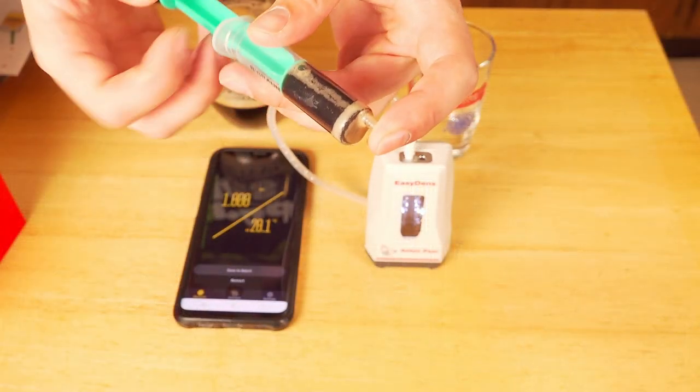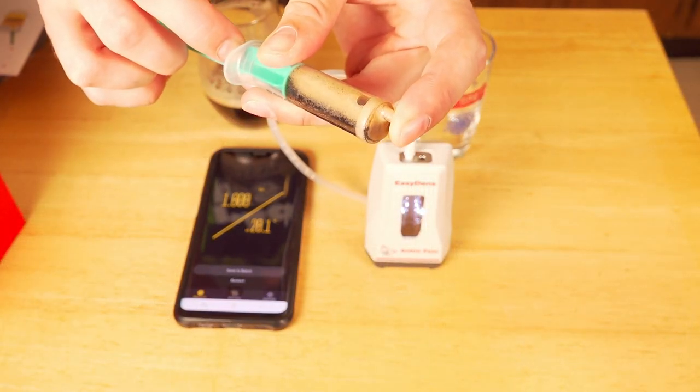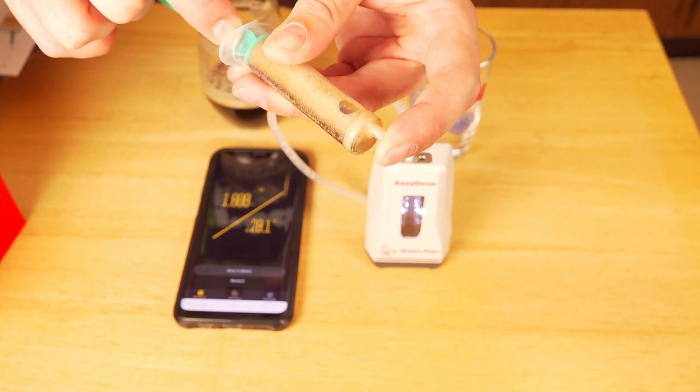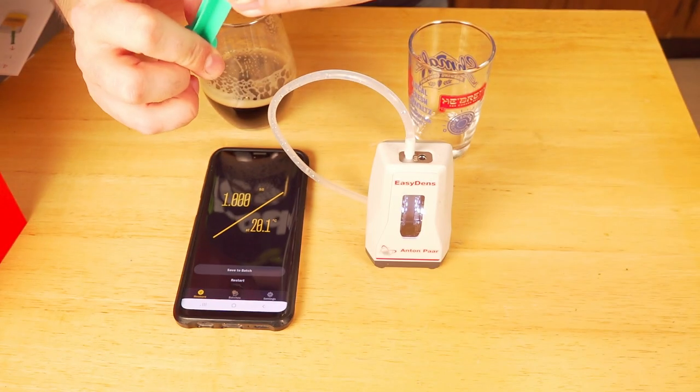When you're measuring your specific gravity you're going to need to take a sample of wort or beer and treat it accordingly to take an accurate measurement. The first thing you're going to want to do is decarbonate it. You want to pull the CO2 that's in solution — even during fermentation there's going to be dissolved CO2 — out of solution so you have a much more accurate reading. Usually that just means shaking it up a lot, or pouring back and forth between two containers using a hard pour to get that CO2 to come out, which usually works pretty well.